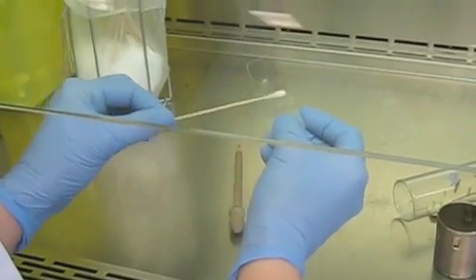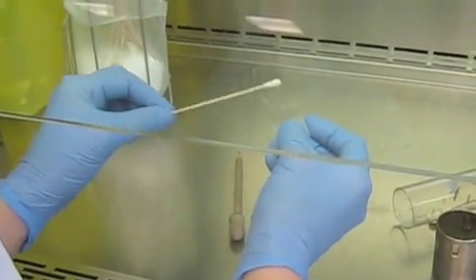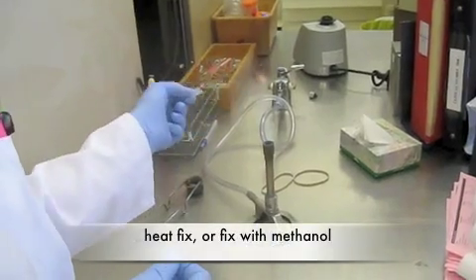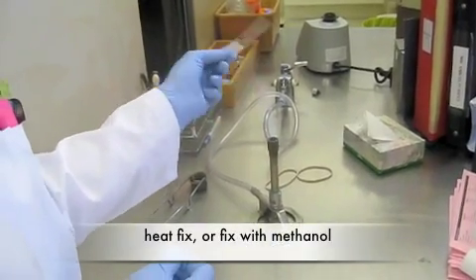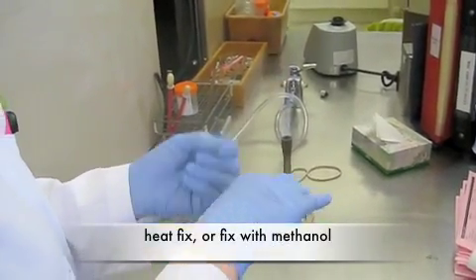The first step is to add bacteria to the slide. Briefly heat-fix the slide, or use methanol as an alternative.